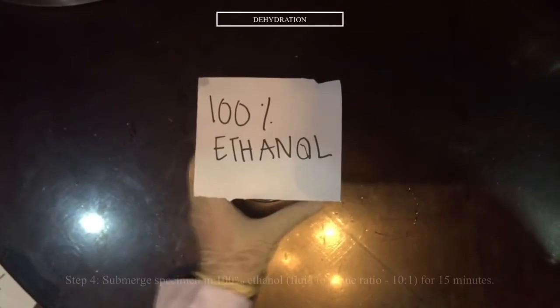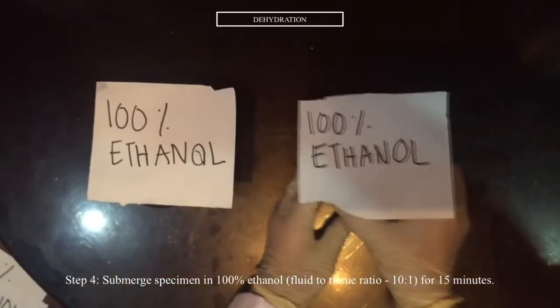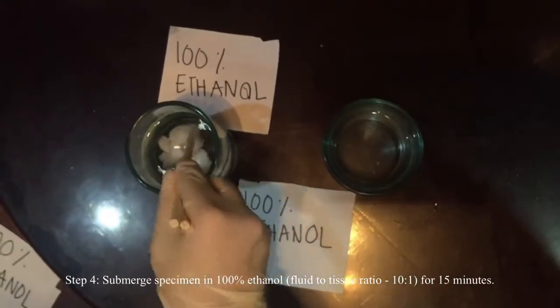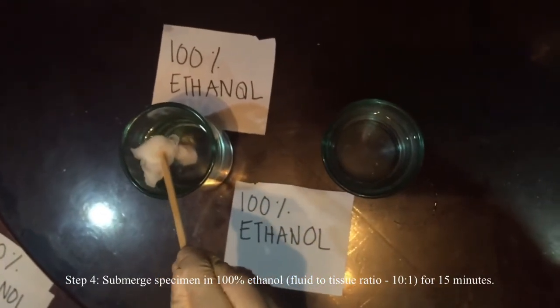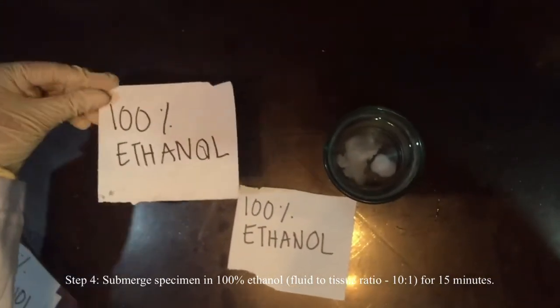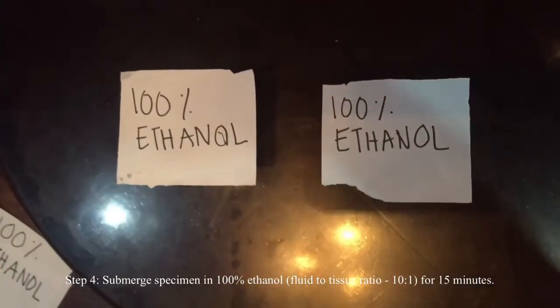So after waiting for 15 minutes, let us now proceed to step 4, which is our second change of absolute ethanol. So we're going to submerge it in the second change of absolute or 100% ethanol for another 15 minutes.